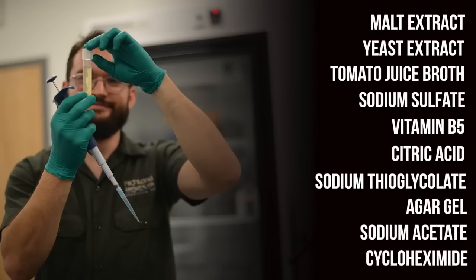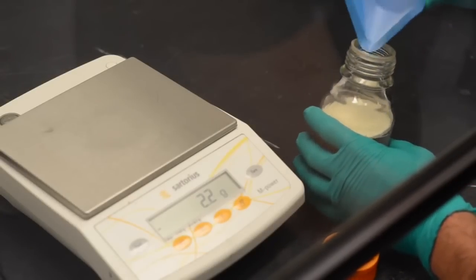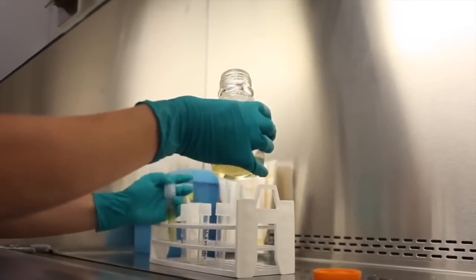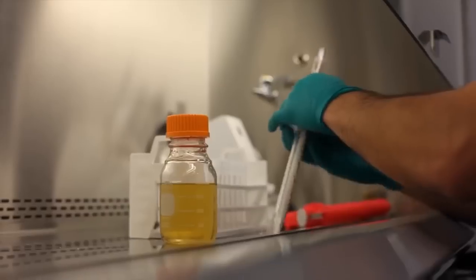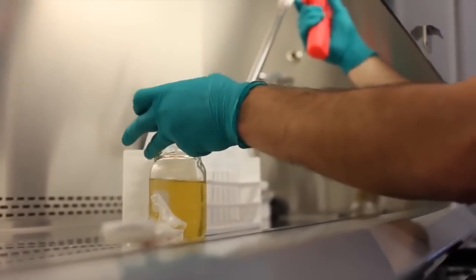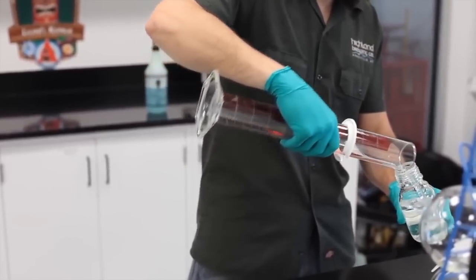Cyclohexamide, also known as actidione, inhibits protein synthesis in eukaryotes. It has no effect on prokaryotes. This means that yeast growth is suppressed while bacterial growth is allowed to flourish, making it an ideal compound to screen for bacteria in breweries. Now be warned, you are also a eukaryote. Cyclohexamide is a potent toxin, so consult your material safety data sheets and follow safety procedures. So now we've got this great cocktail of nutrients for microbial growth, but we've selected against yeast, gram-negative bacteria, and aerobic microbes. The only category of microbes that will thrive in HLP are gram-positive, anaerobic bacteria. In brewery settings, that is usually Lactobacillus or Pediococcus.